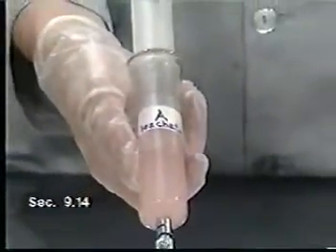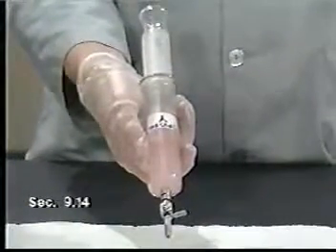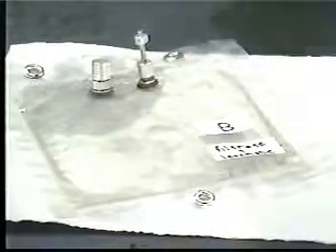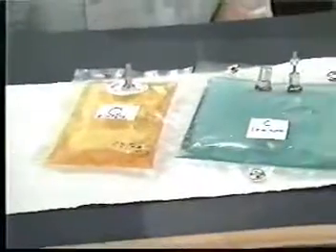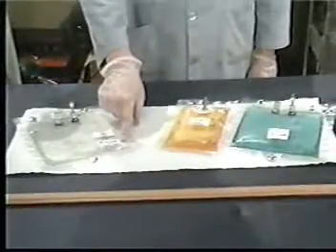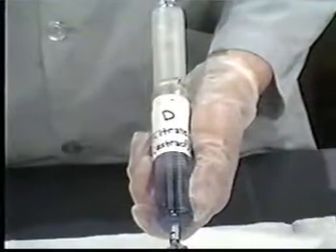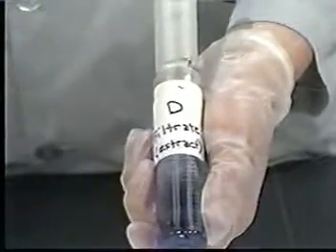If the original waste contained no liquid phase, the filtered leachate is defined as the TCLP extract. This was the case for our waste A. If the waste contained an initial liquid phase, like our B and C, the filtered leachate and the initial liquid phase are collectively defined as the TCLP extract. Recall that we put aside the initial liquid phase of our waste D because it contained no significant solids to be leached. It was itself defined as the TCLP extract.